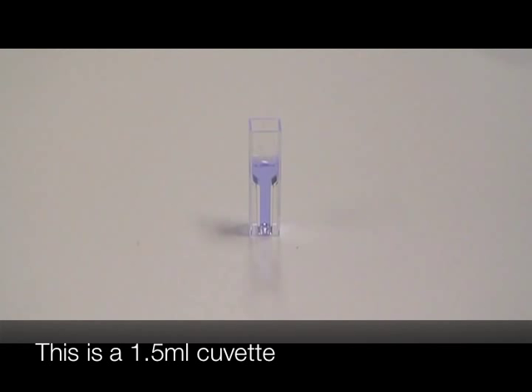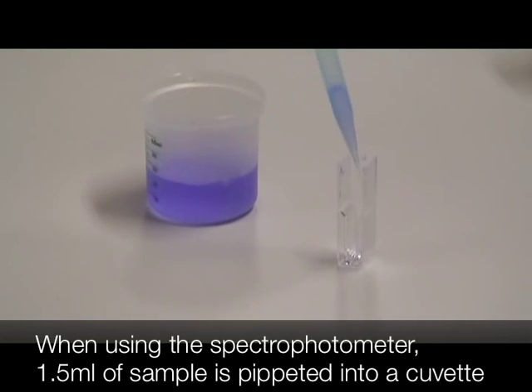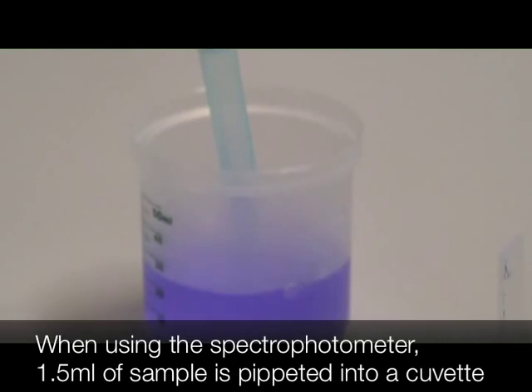This is a 1.5 milliliter cuvette. When using the spectrophotometer, 1.5 milliliters of sample is pipetted into a cuvette.